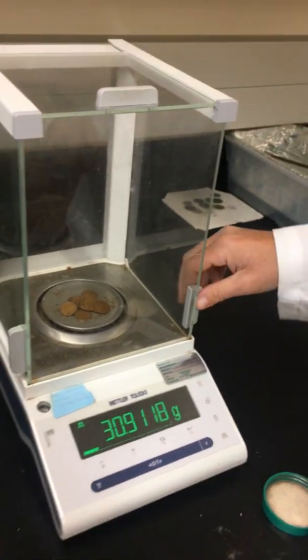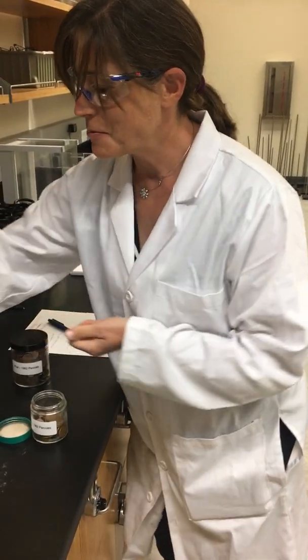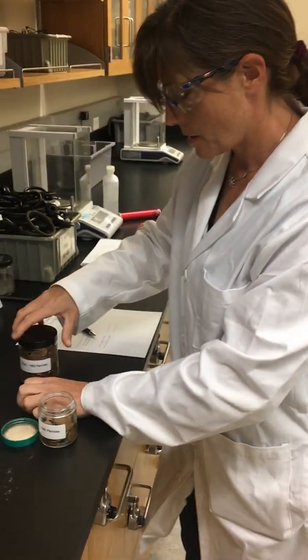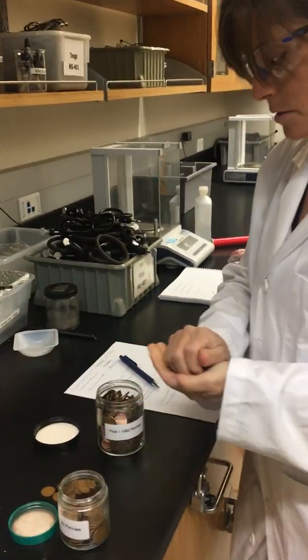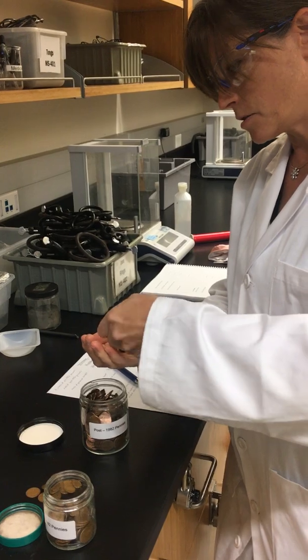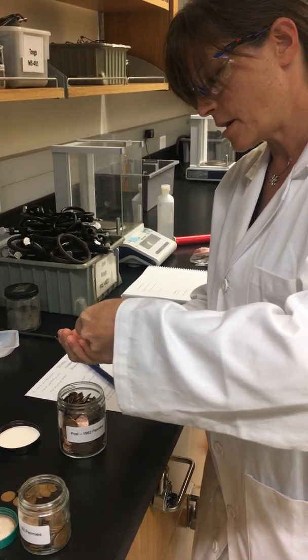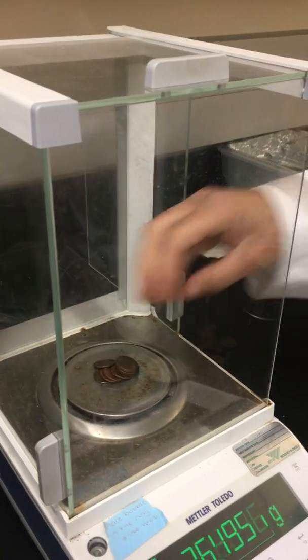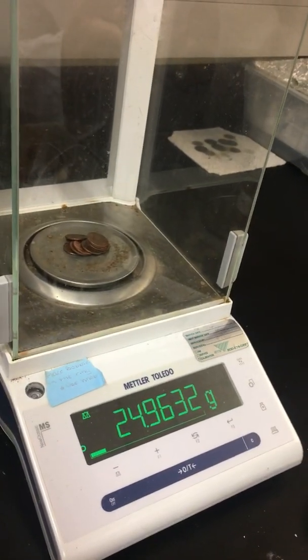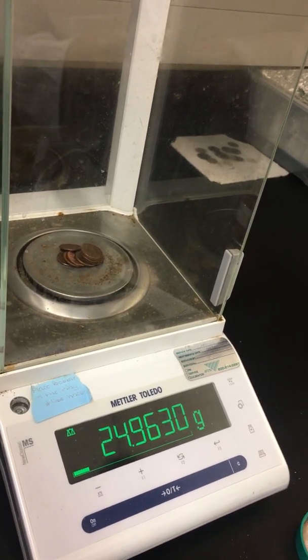Now we're going to take the mass of 10 post-1982 pennies. Let me remove the previous pennies. Now we'll take our post-1982 pennies and get the mass of 10 of them. Let's count out 10: 1, 2, 3, 4, 5, 6, 7, 8, 9, 10. We'll add these to our balance. Our mass is 24.9630 grams.